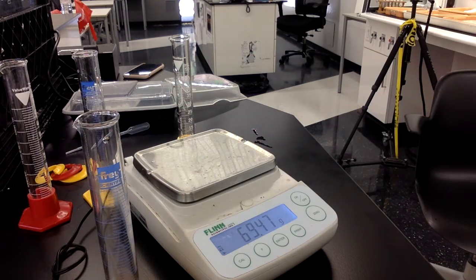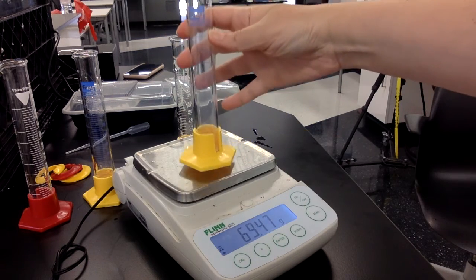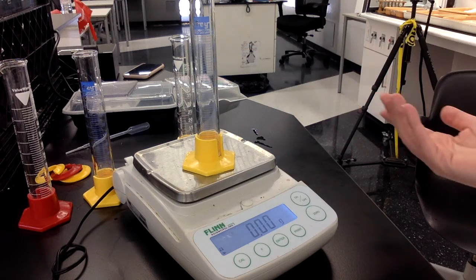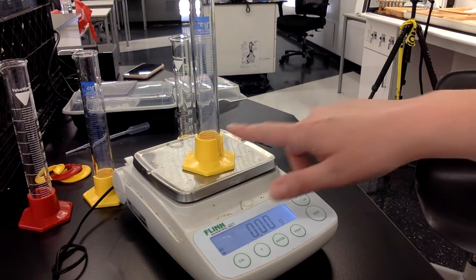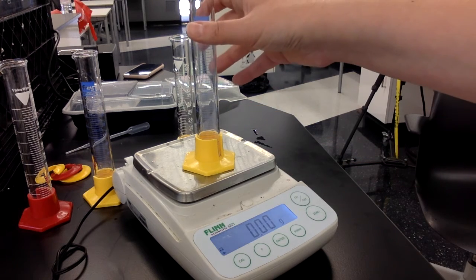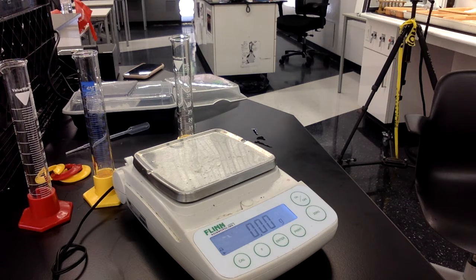The next part of the lab wants you to add water to the graduated cylinder so it's approximately a third full. This graduated cylinder is 50 milliliters, and it's a little difficult to do 50 divided by 3. It's going to be somewhere clearly between the 15 and the 20 mark. We don't need to take it that route. Let's just say that we're going to fill it up to 20 milliliters. So I'm going to move to that part of the lab.